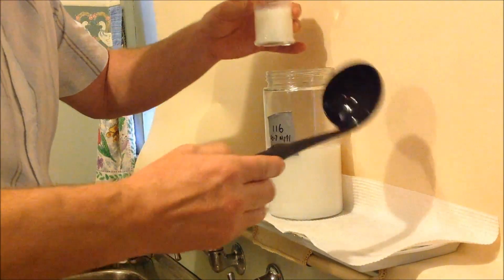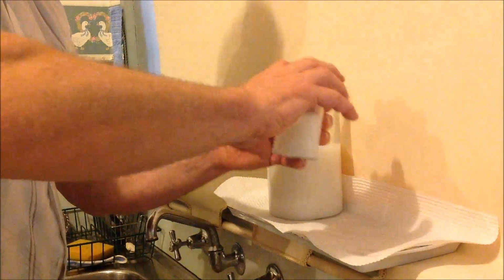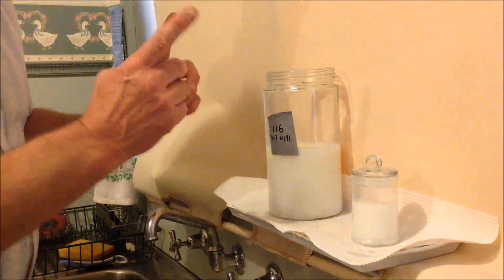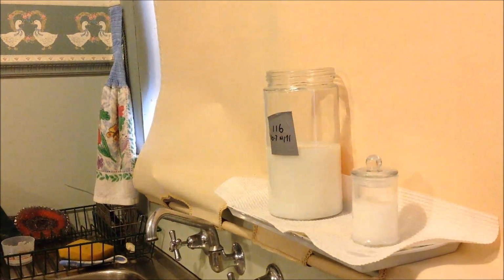Now I probably don't need too much of this to compare at the next stage of the experiment, because as you know we don't get that much. Anyway, so I'll put that aside and I'll catch you when I've re-precipitated this. I know, very official looking, official engagement today. Ignore it. Well, we're on to the next stage.